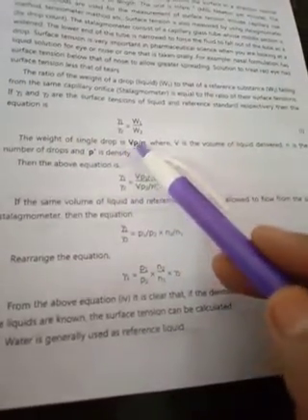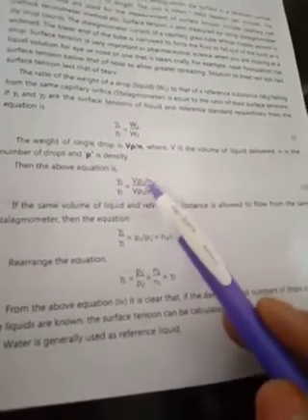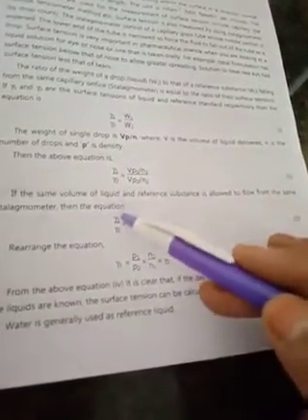The weight of a single drop is given by Vρ/n, where V is the volume of liquid delivered, n is the number of drops, and ρ is the density. The equation becomes: γ1/γ2 = (Vρ1/n1) / (Vρ2/n2). If the same volume of liquid and reference substance flows from the same stalagmometer, the volume V cancels.